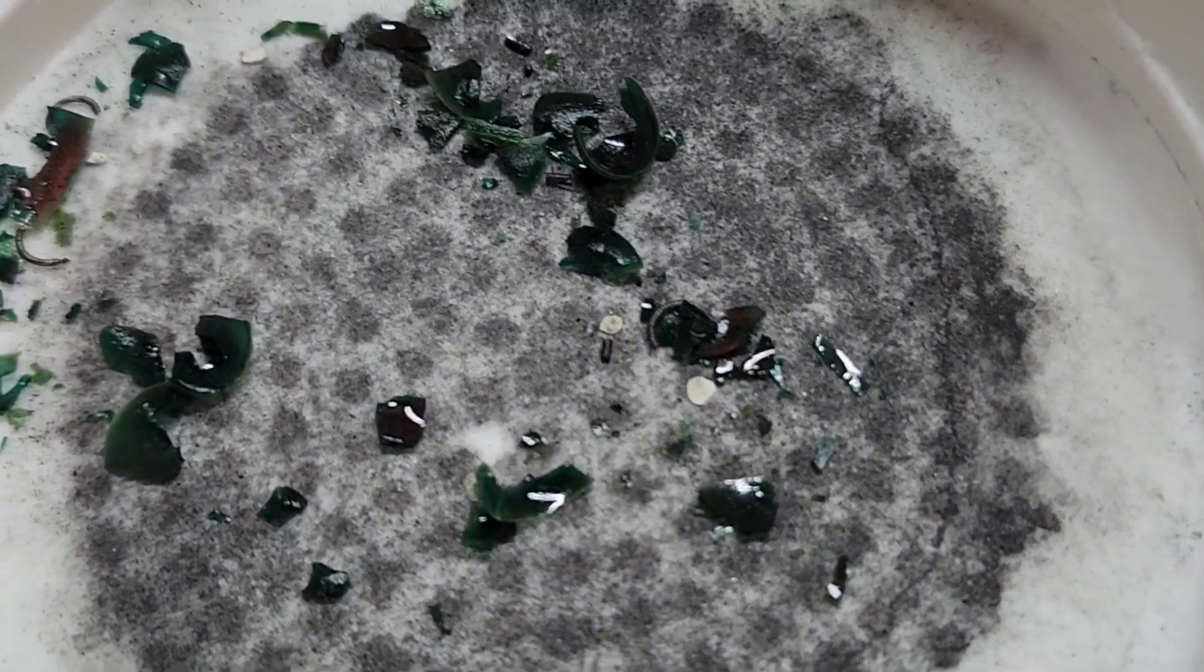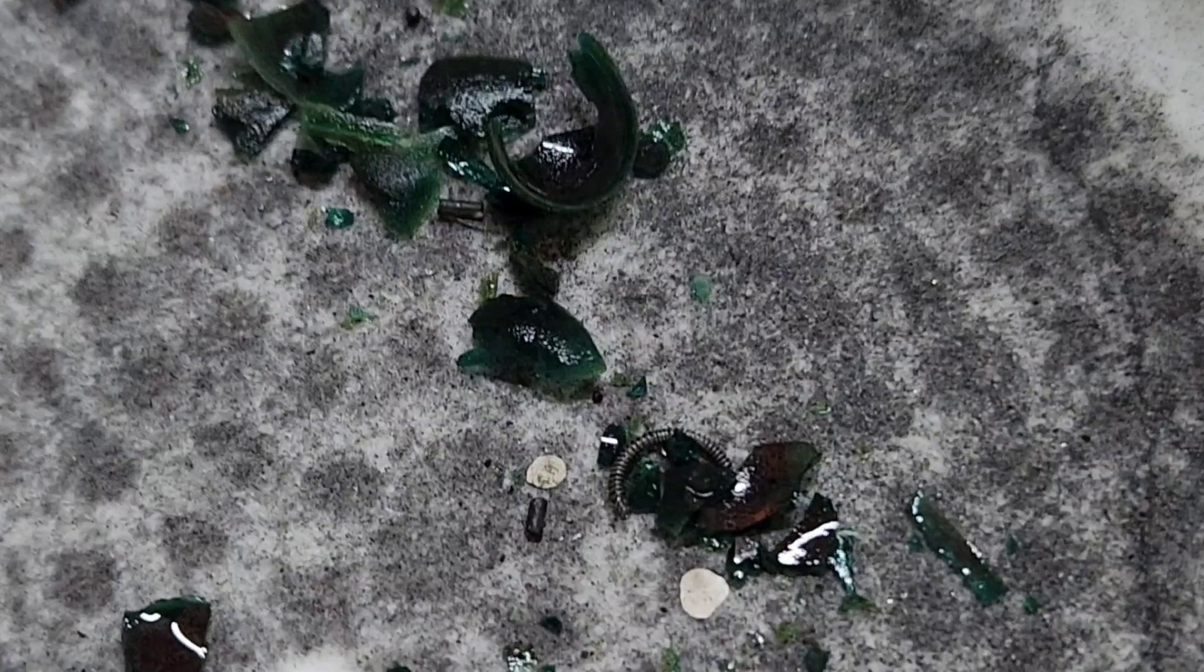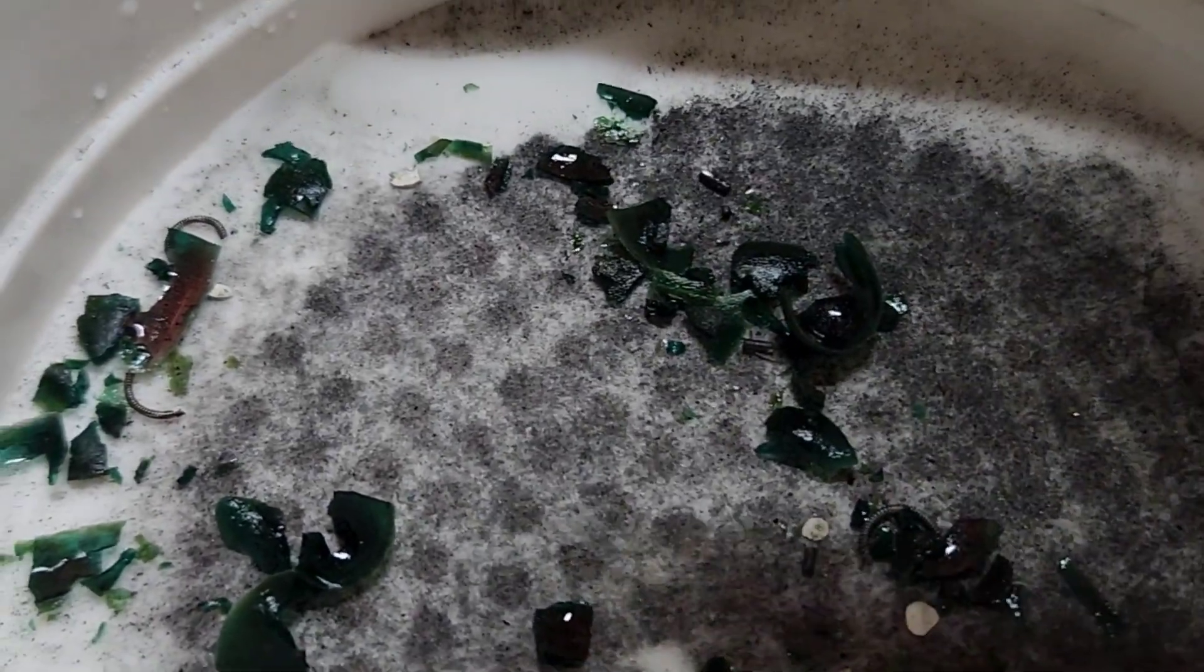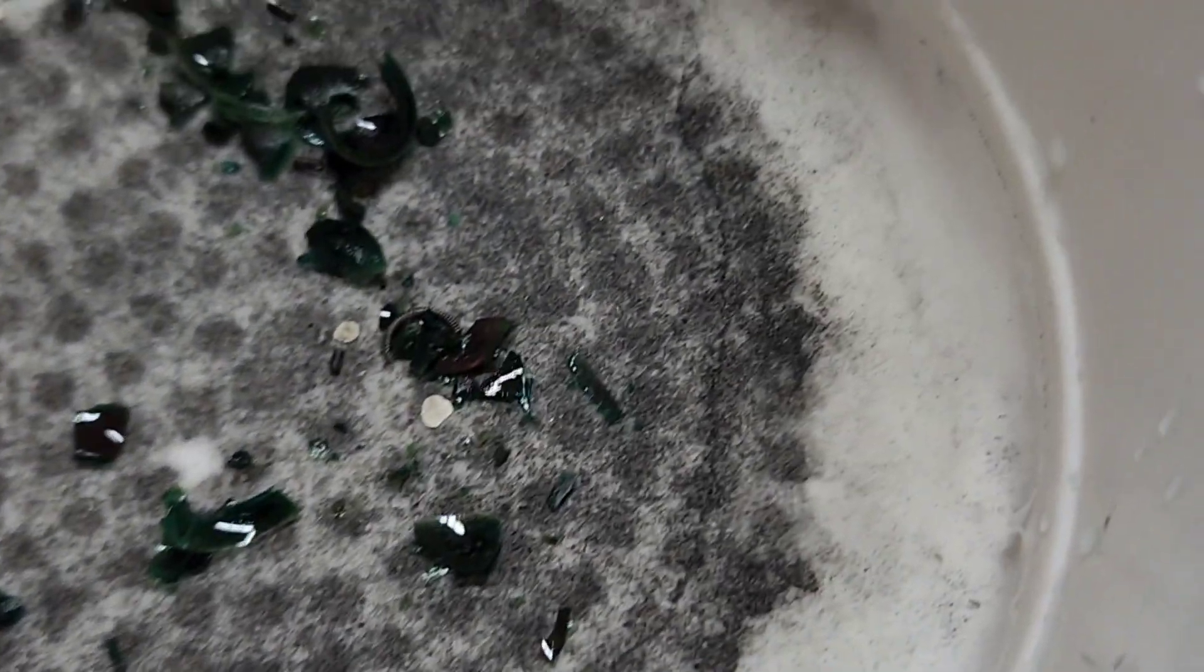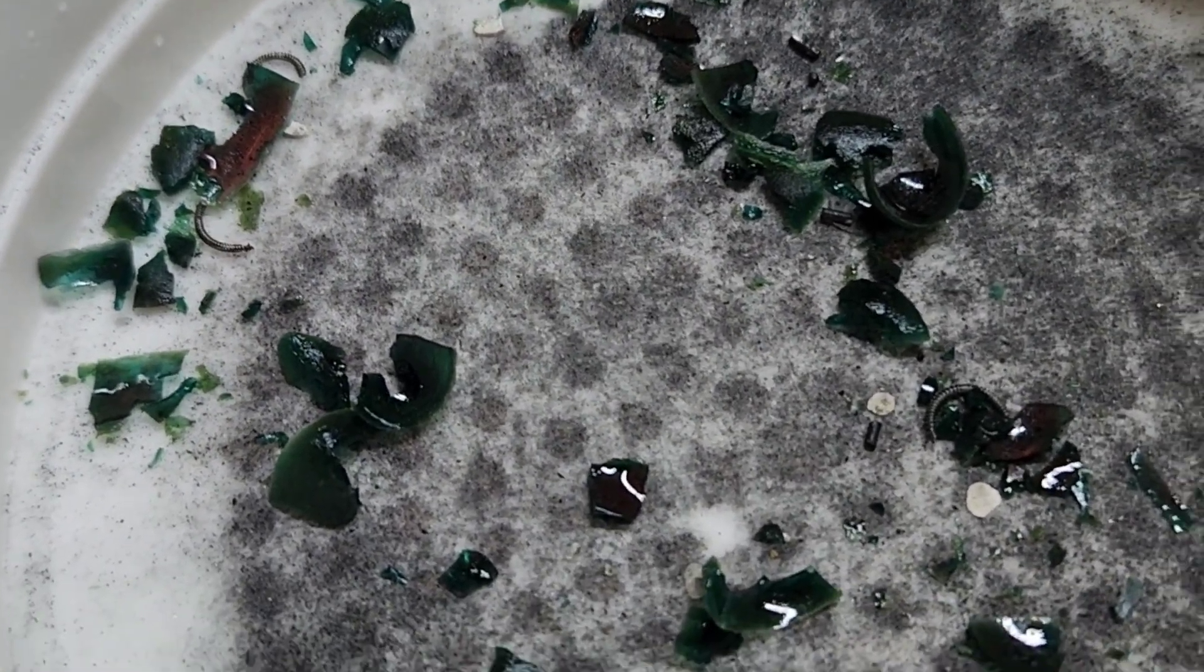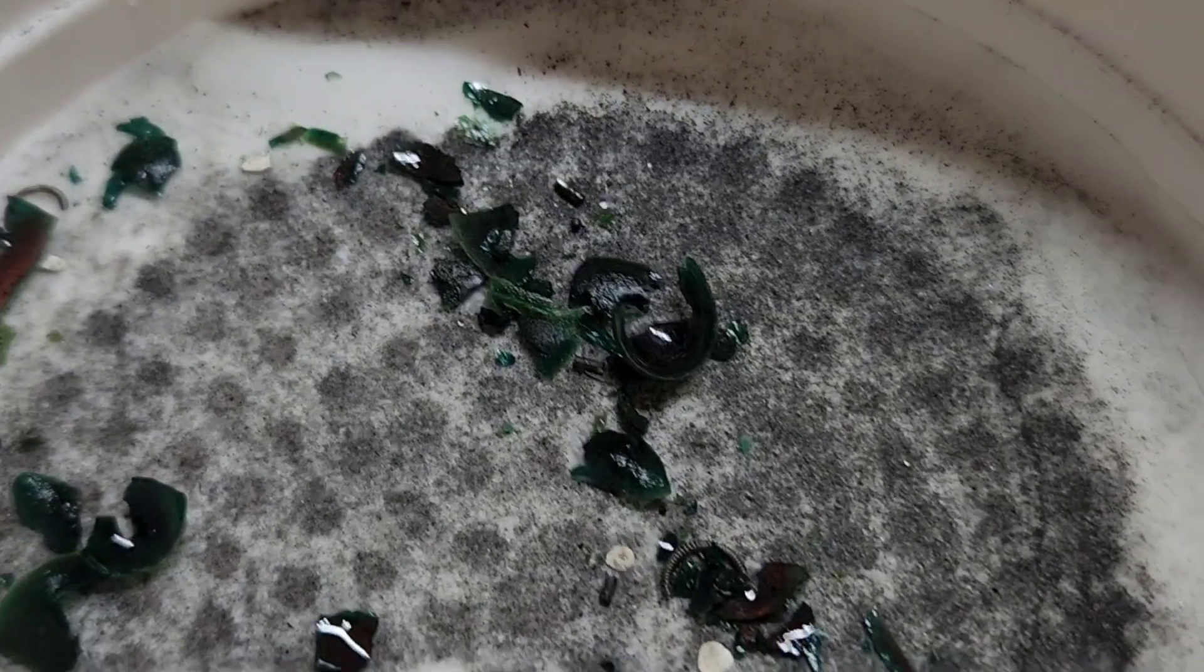So as you can see, dang near right in the center there, we've got two very small pieces of silver left. So we might not have any leftover nitric because like I said, we didn't have any fumes. There might be another one right up there. But yeah, there we go. The epoxy stayed in shape for the most part, cracked up, but that could have easily have happened when I was incinerating.